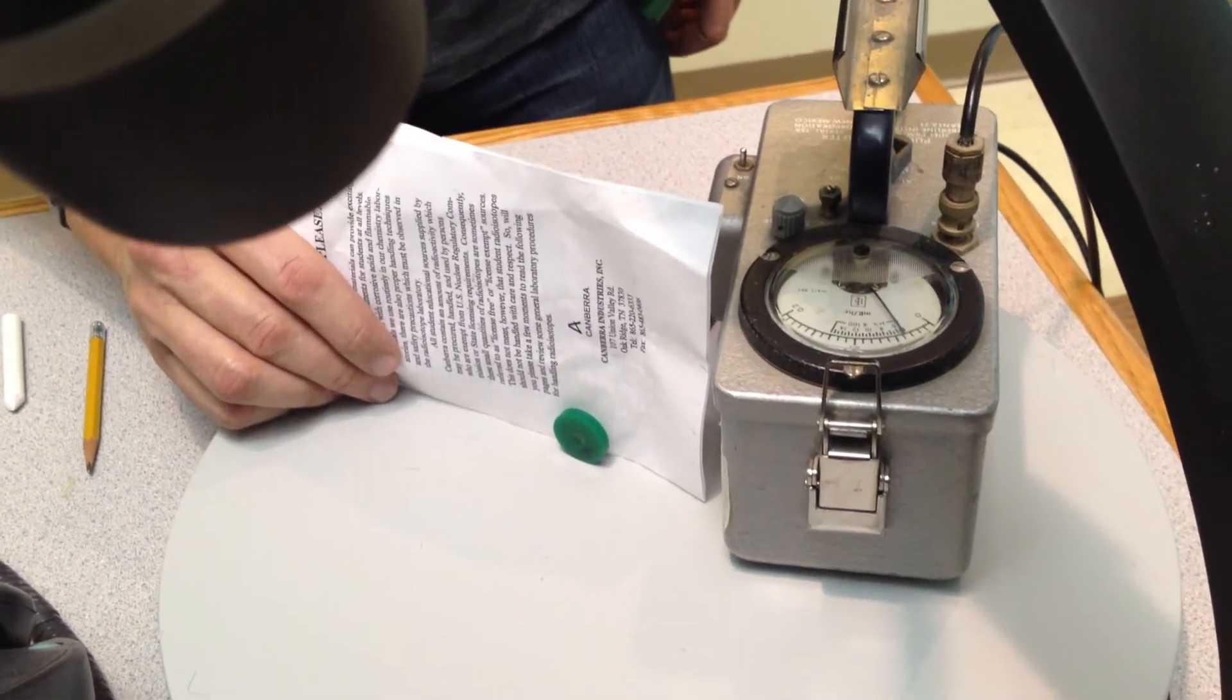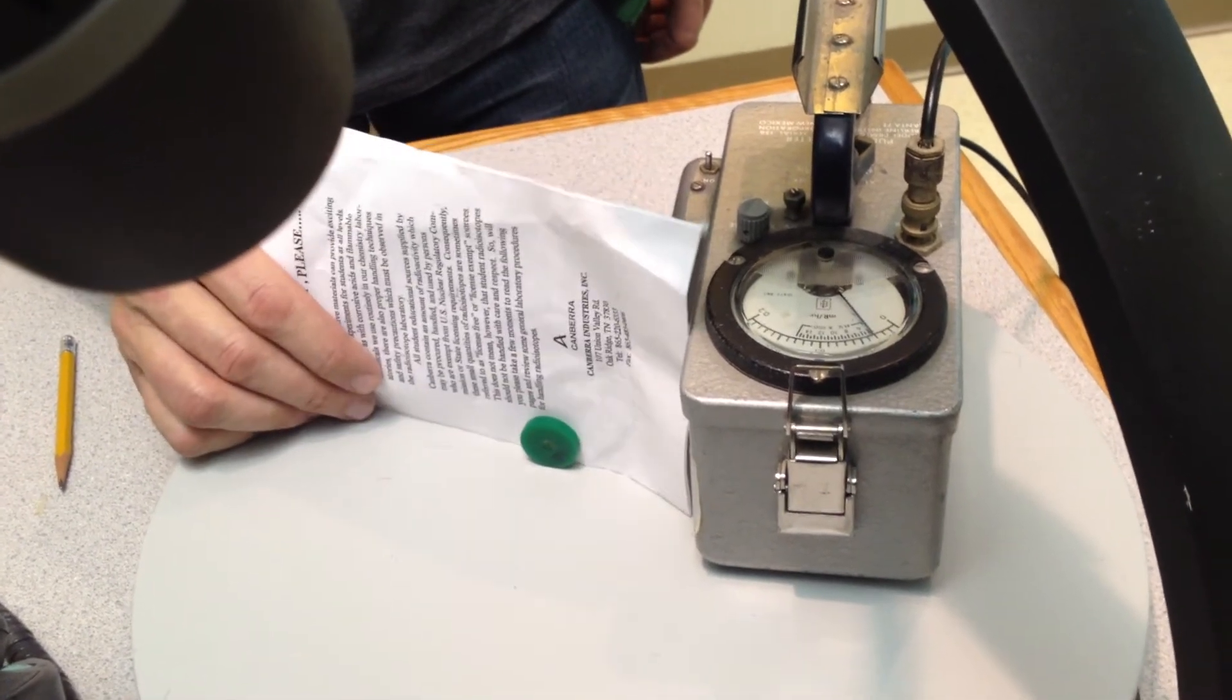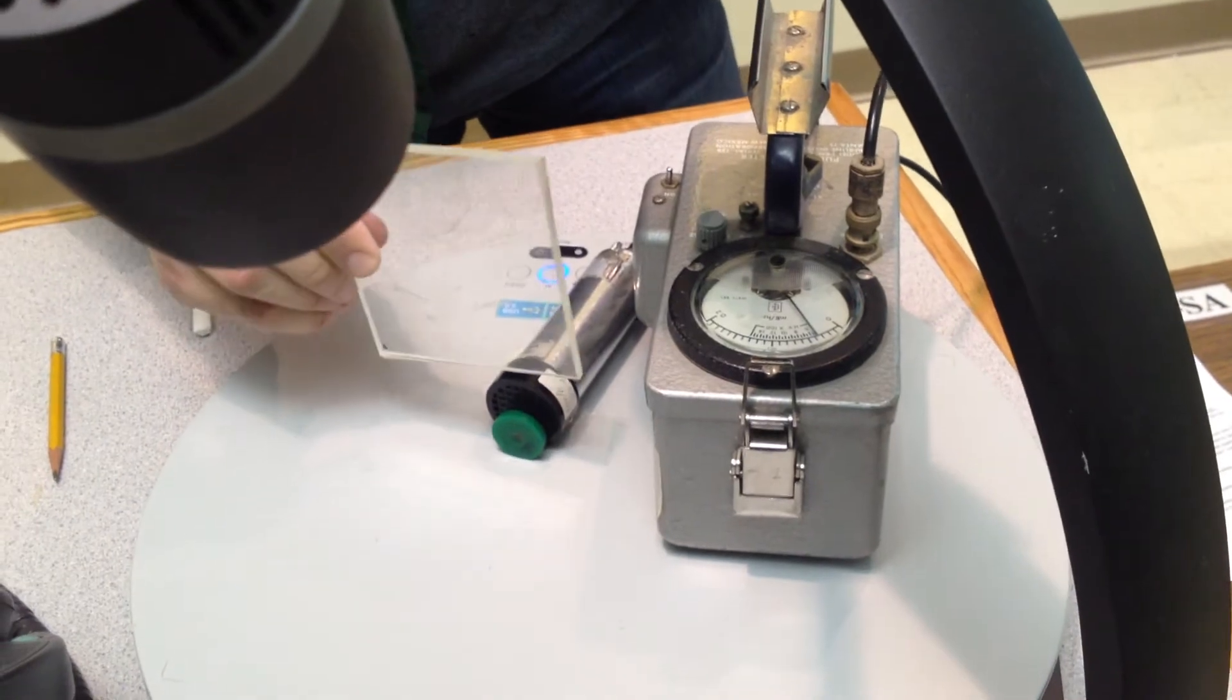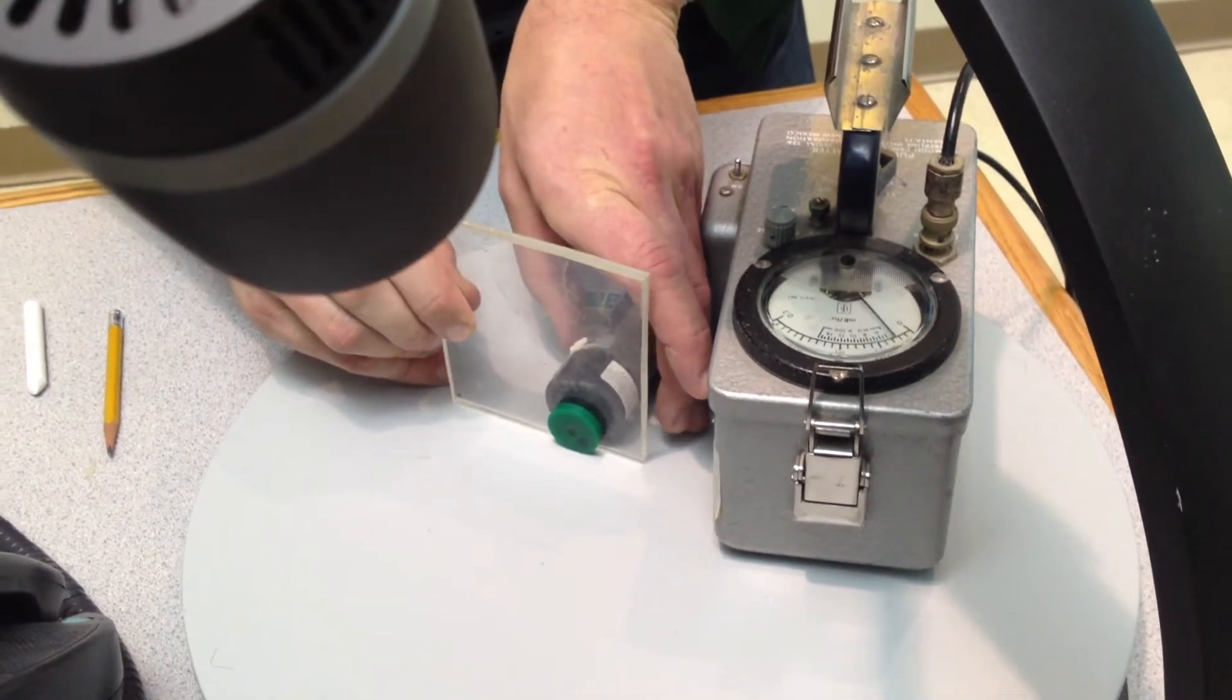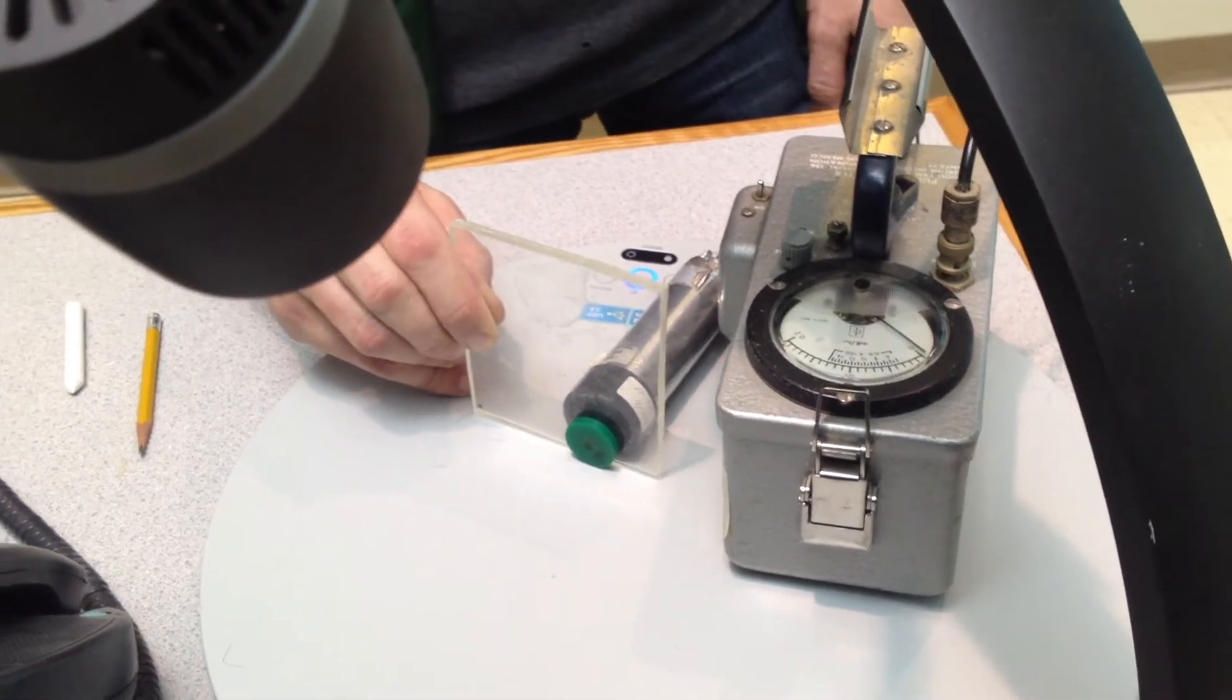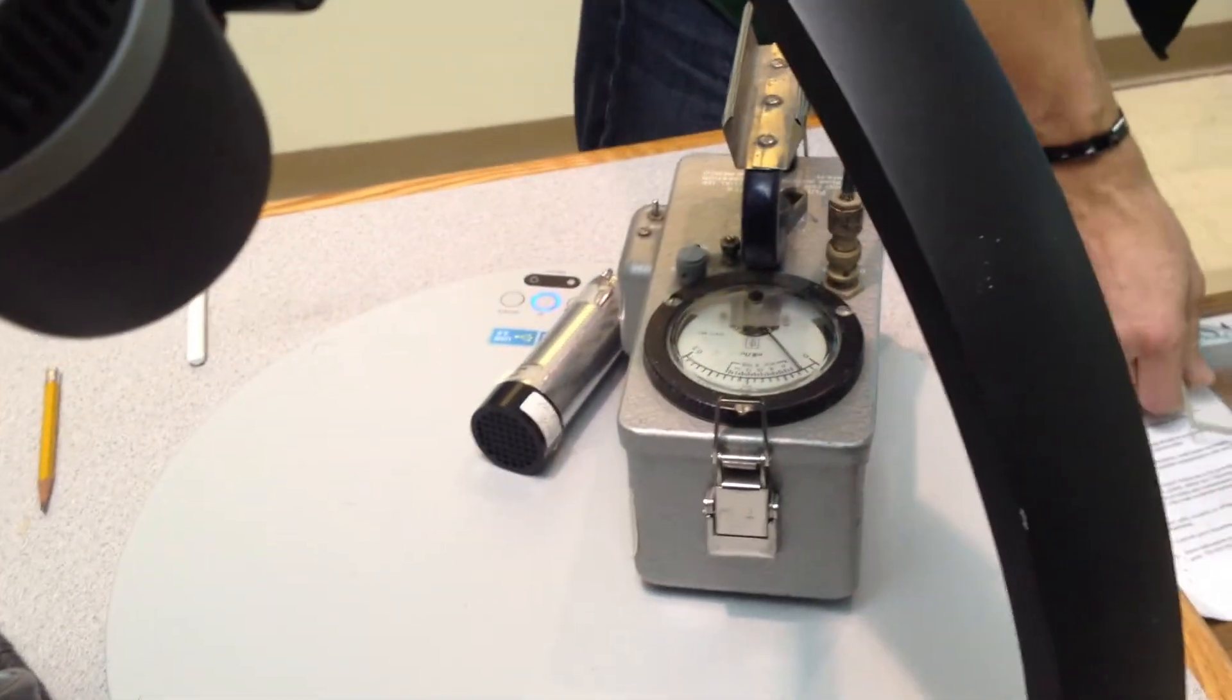Now, how's the paper doing? How's the paper doing? Not doing so well, is it? So now I have a quarter-inch thick sheet of plexiglass. Notice?